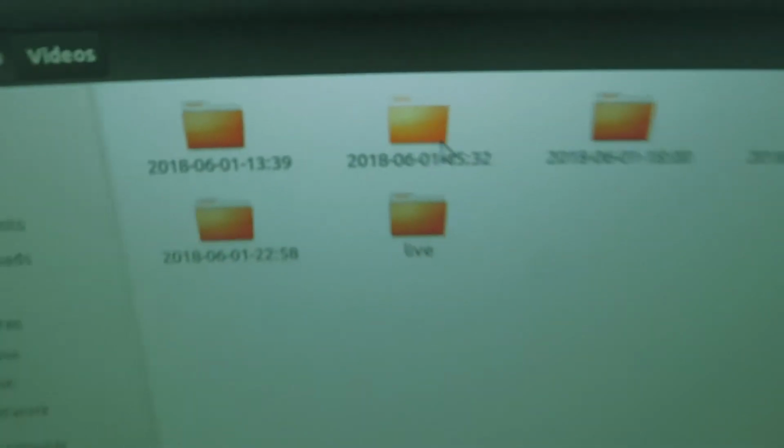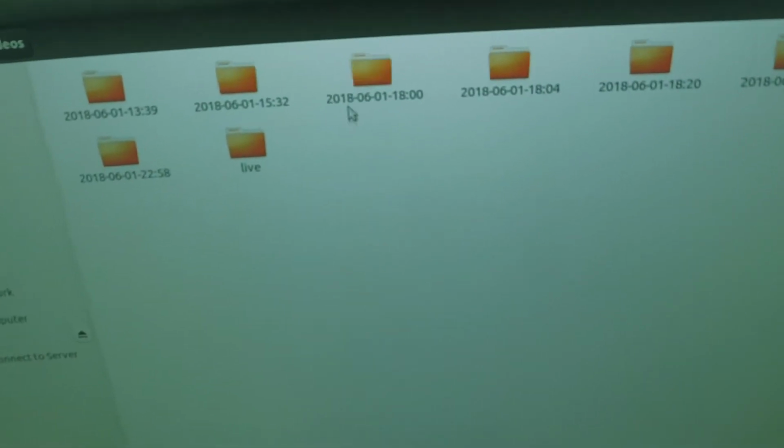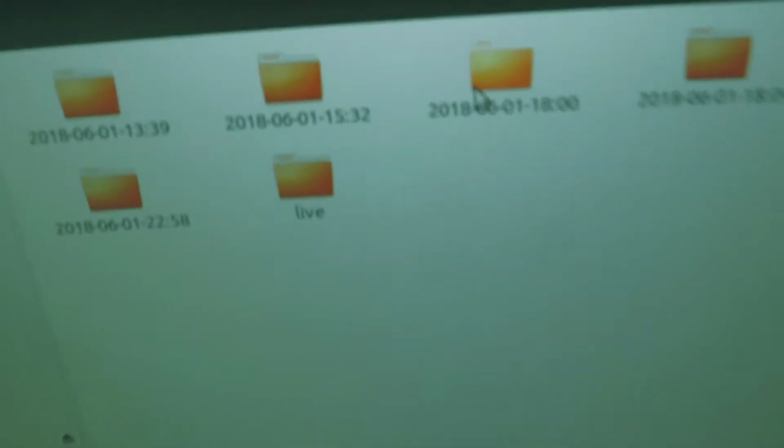So here are the videos. They're all dated, and they're automatically pulled off into individual frames. It'll take a while to load because it captures at 30 frames a second, and testing can last for hours.